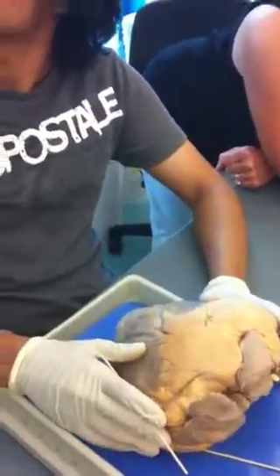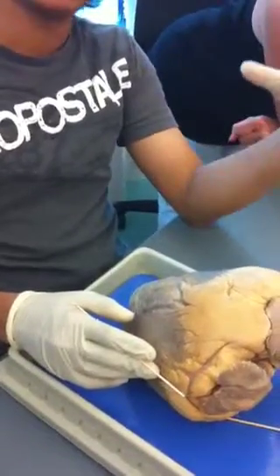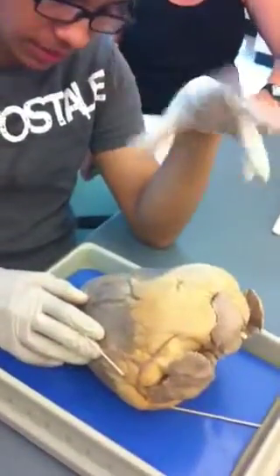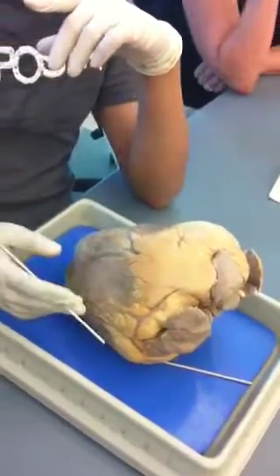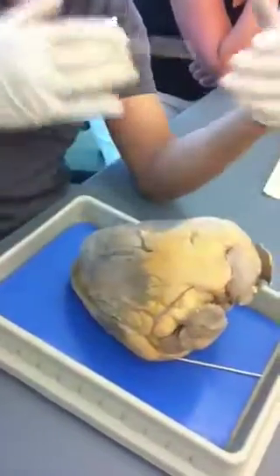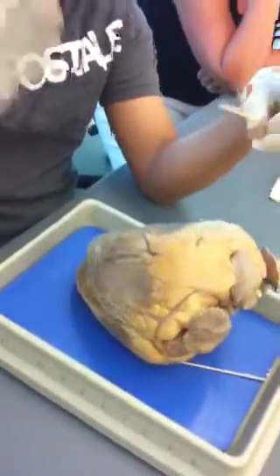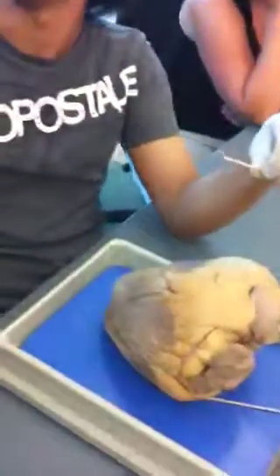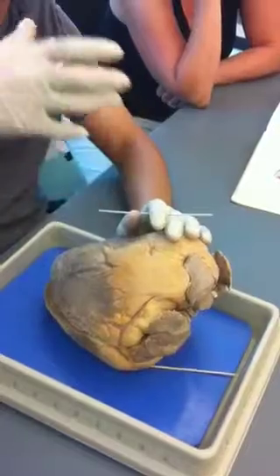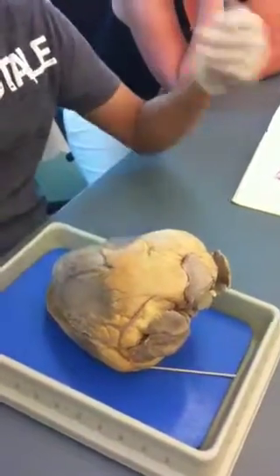And those are both leaving the ventricles? Yeah. Blood leaves the heart and goes to the lungs to get oxygenated via the pulmonary — it leaves the heart by the pulmonary artery, the only one with deoxygenated blood. Just remember that when a vessel is leaving the heart it's called an artery, and generally when it's coming back to the heart it's called a vein. Don't always go by the rule that arteries carry oxygenated blood and are red, and veins carry deoxygenated blood and are blue. The pulmonary artery is leaving the heart going to the lungs, but it's carrying deoxygenated blood. The pulmonary veins are coming from the lungs back to the heart, but they're carrying oxygenated blood.